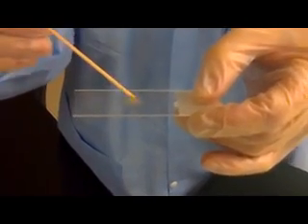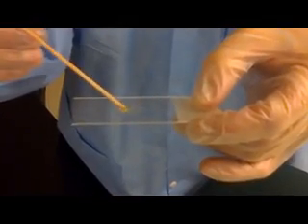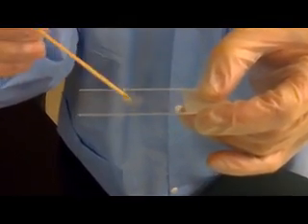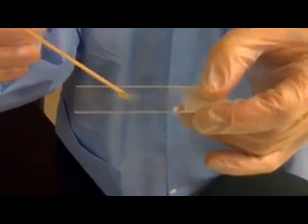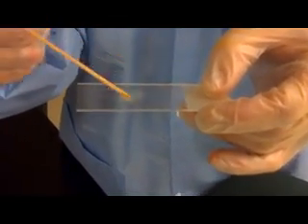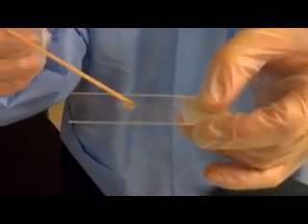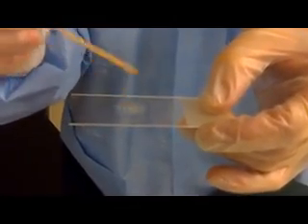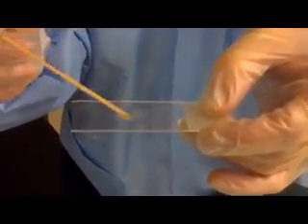You can see where it's starting to thicken. You can see where it's beginning to string with the toothpick. That indicates that it is a gram-negative organism.